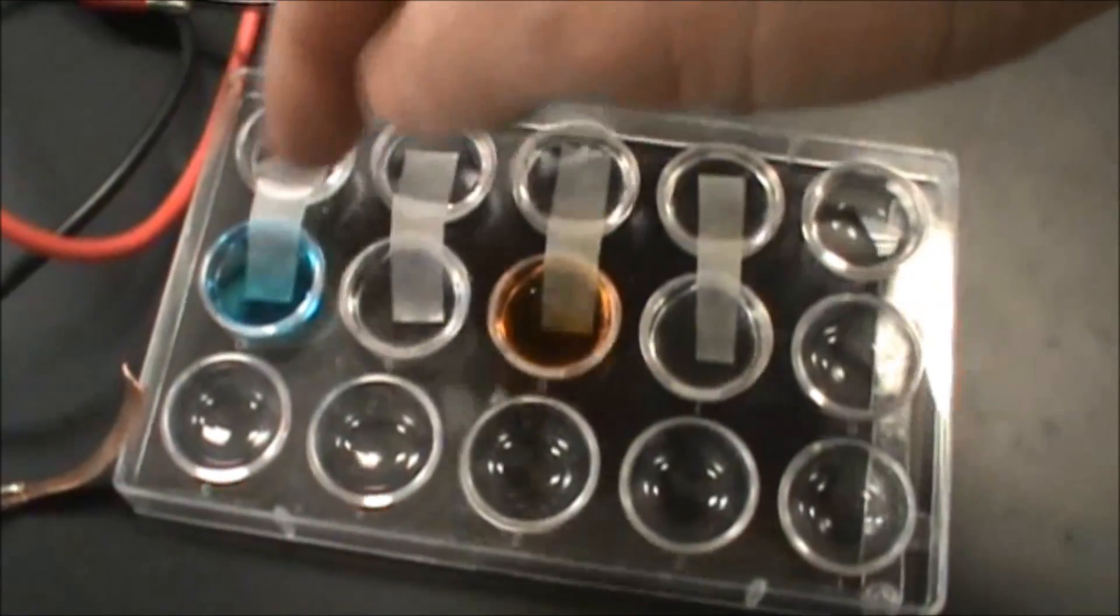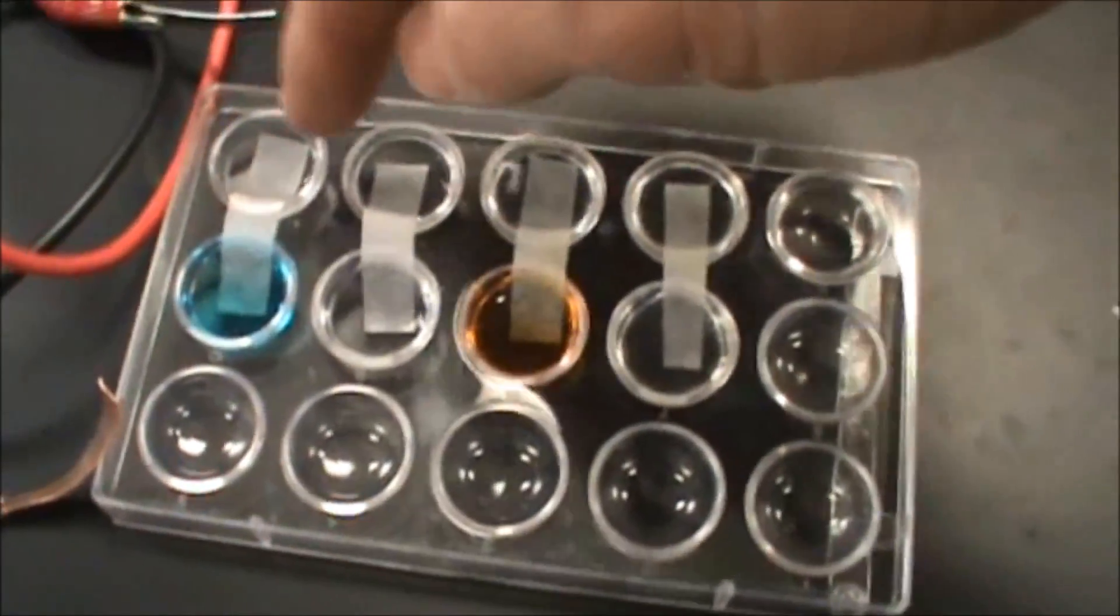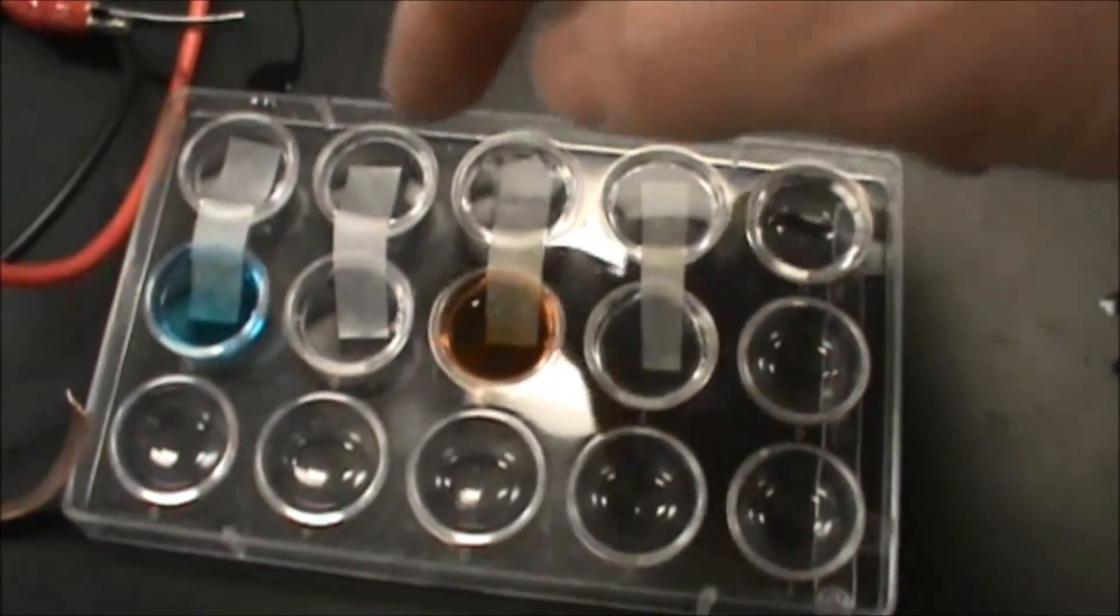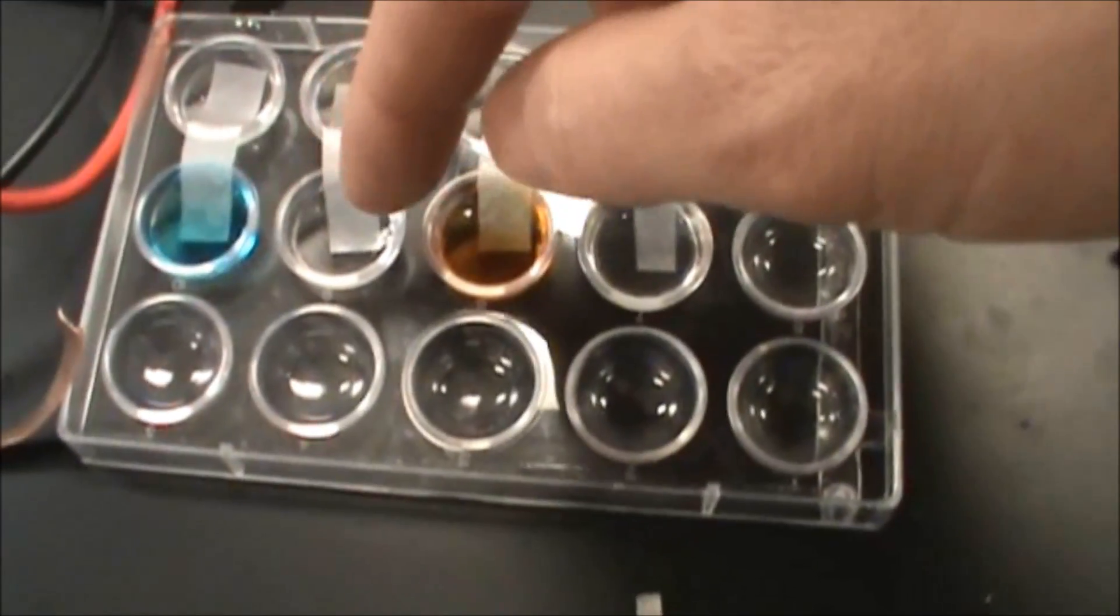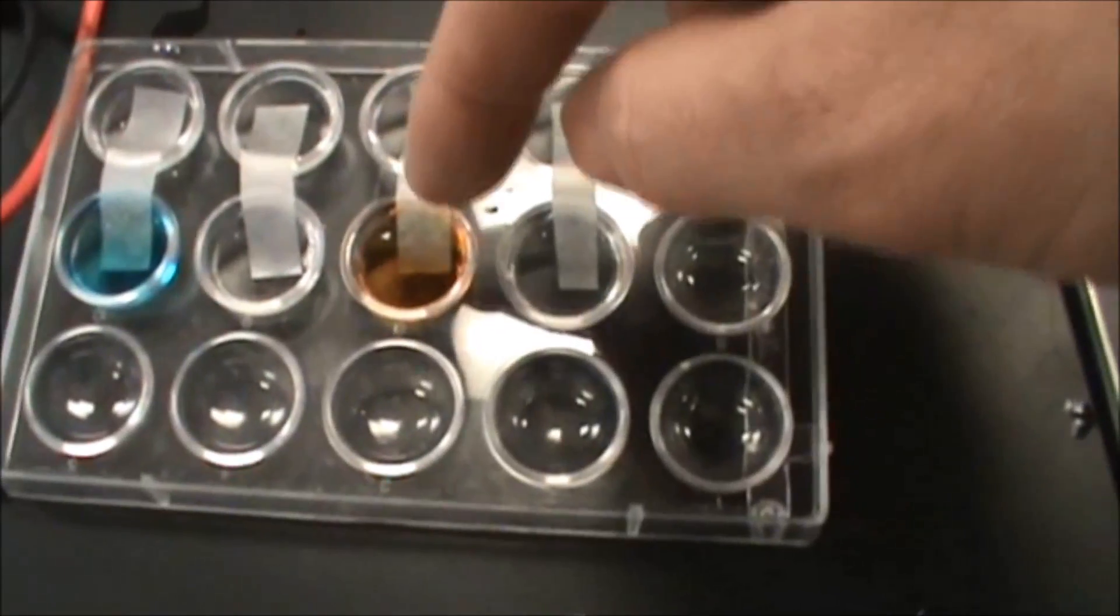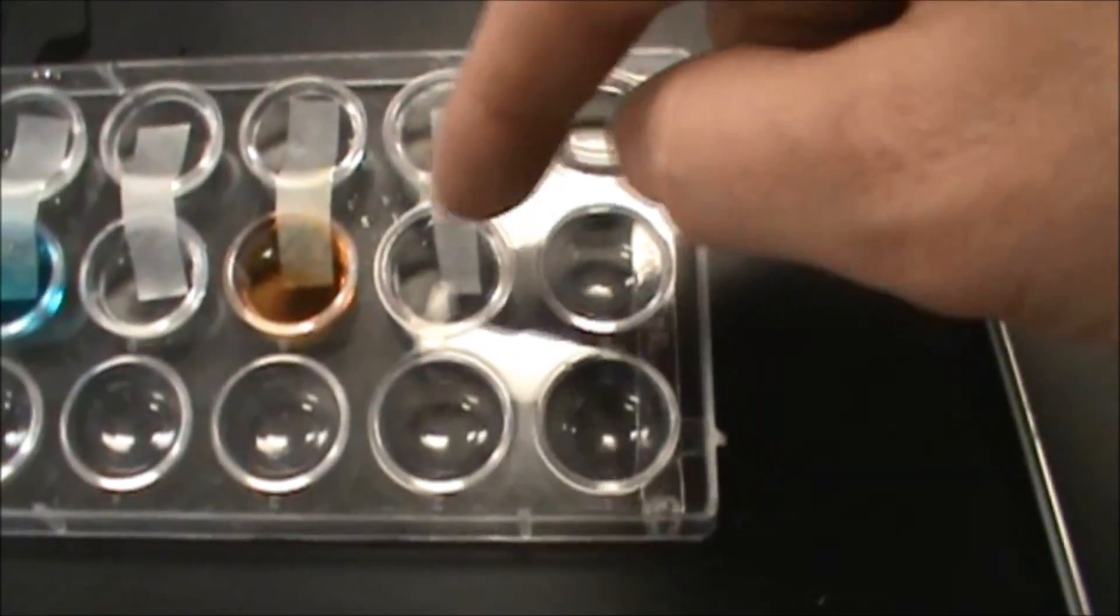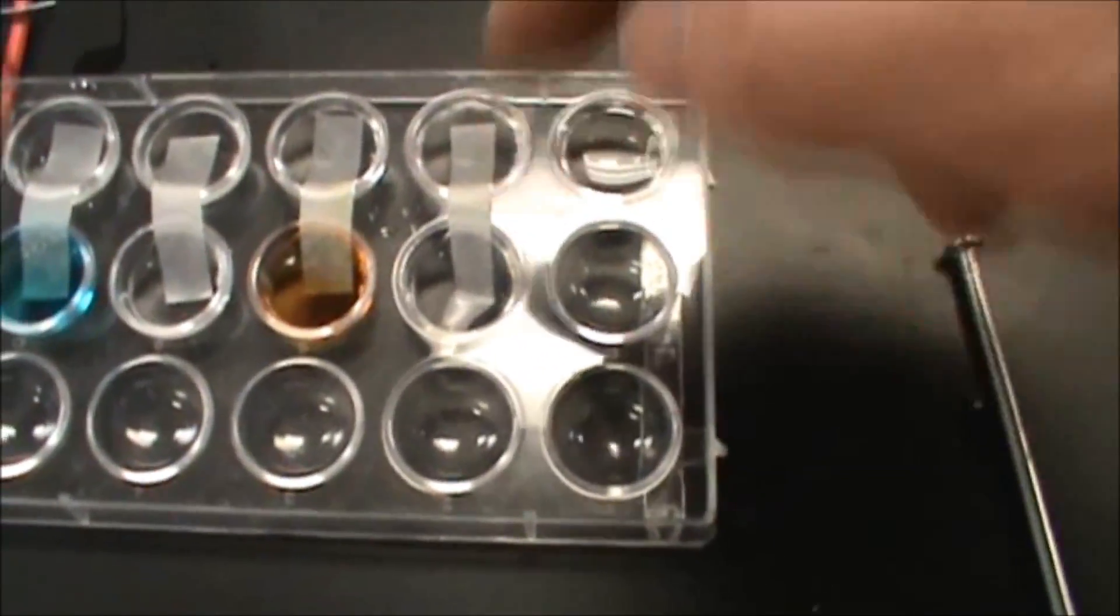This is our battery lab. We have a copper solution here, zinc solutions all across the top. Then we have a silver ion solution, iron ion solution, iron three, and we have a magnesium ion solution.